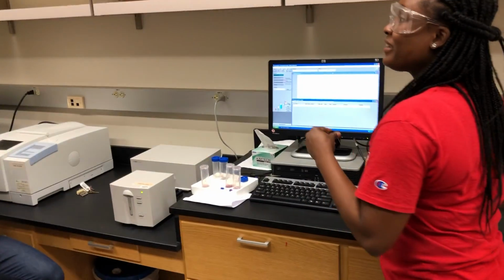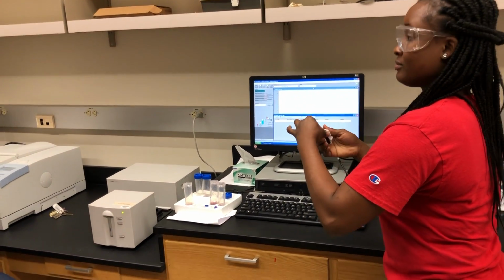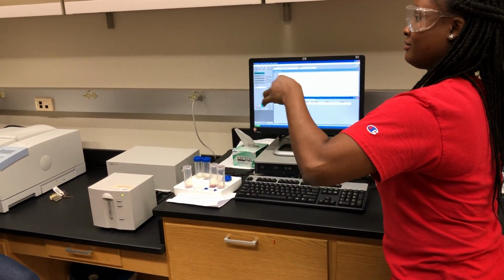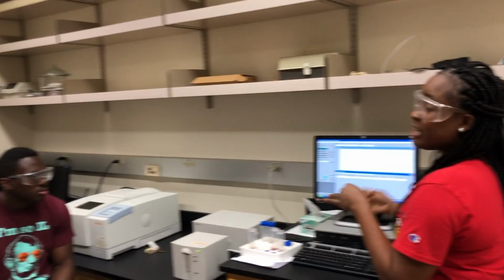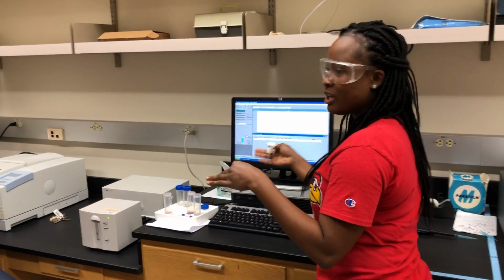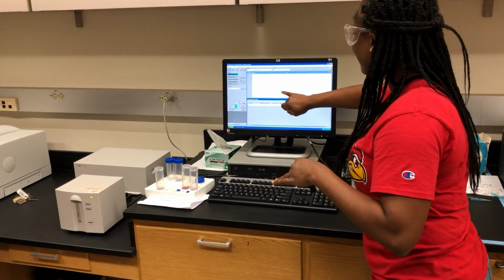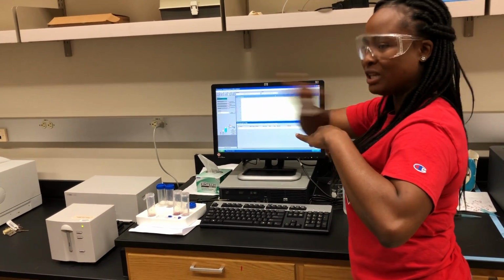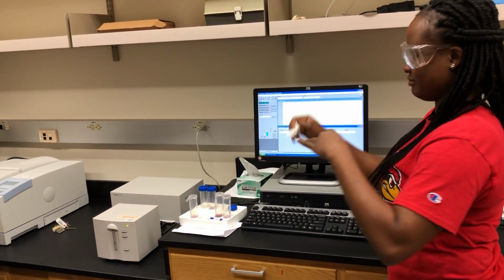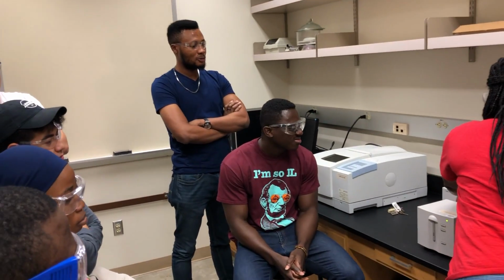I have a question. Okay. So, does the UV only tell us the size of the nanoparticle? Can it also tell us the amount of particles you have? Yeah, with the UV it can also tell you the amount, and it can also tell you the polydispersity of your nanoparticles. Looking at this, a broader peak tells you that it is more polydispersed, right? Awesome. That's a great question. Good job. Thank you.